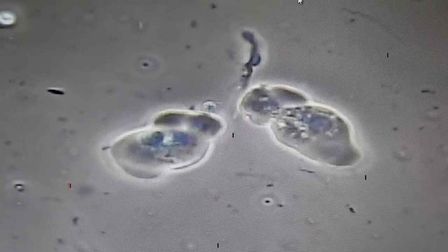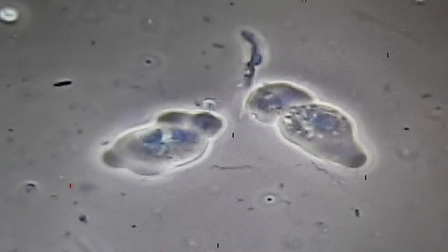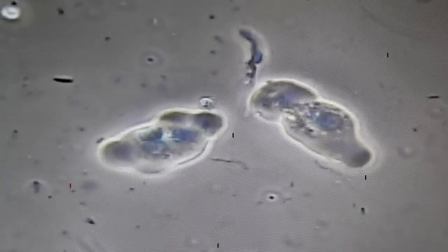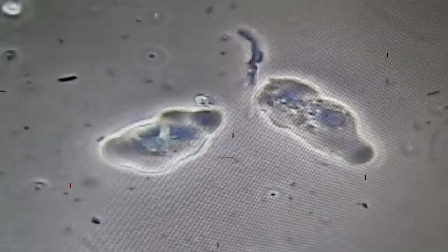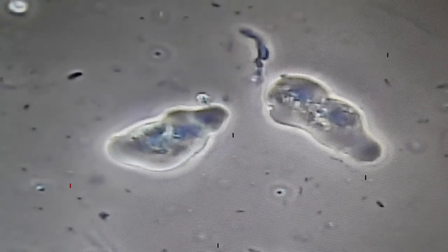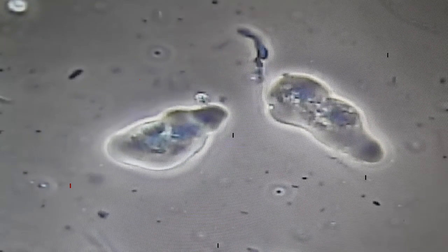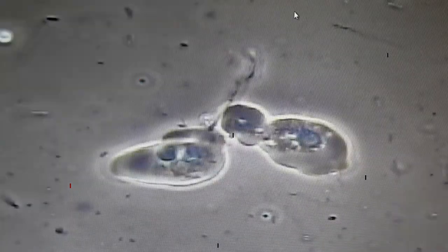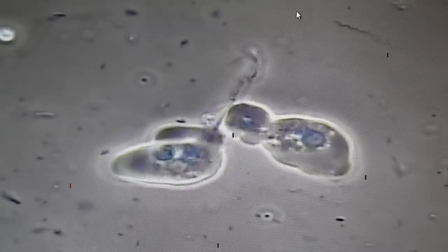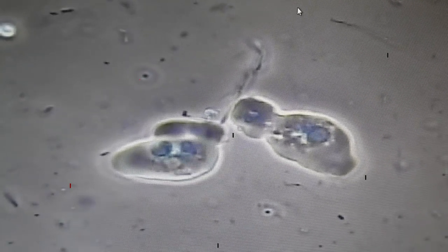The implications of this we'll get to later on, but I wanted you to see visually how dramatic the profile of what goes on in a sample of plaque can be.